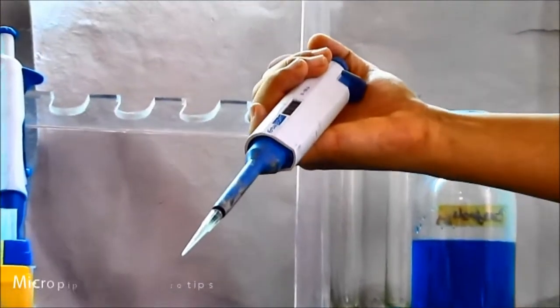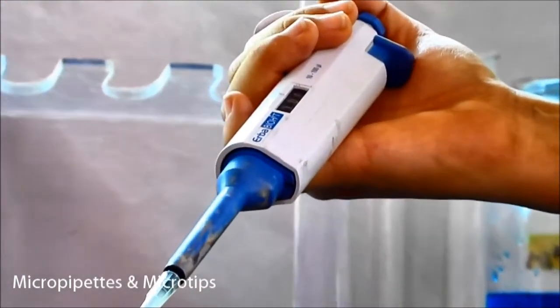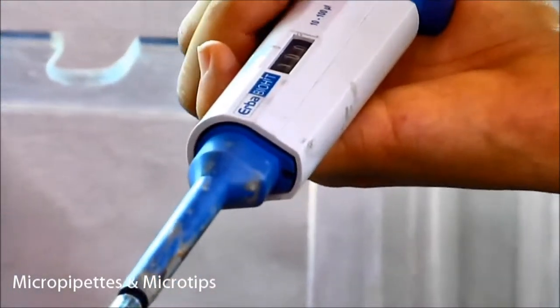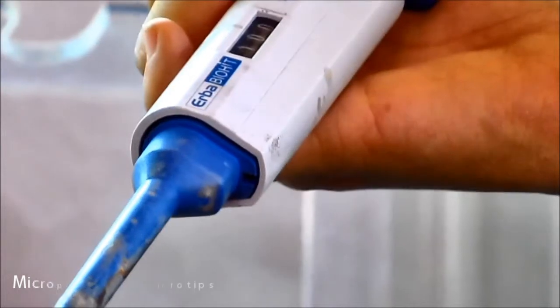This is an automatic micropipette. This instrument is used to draw specified volume of any liquid.